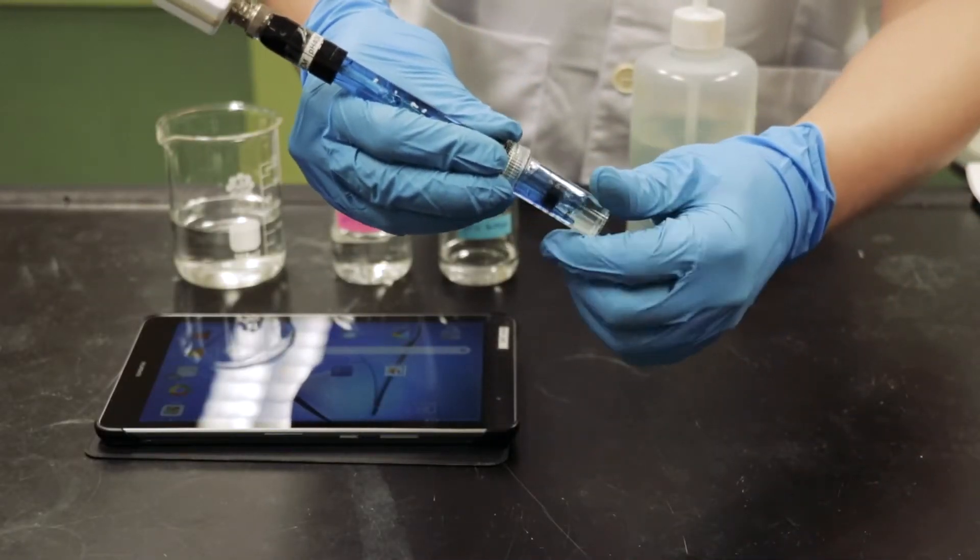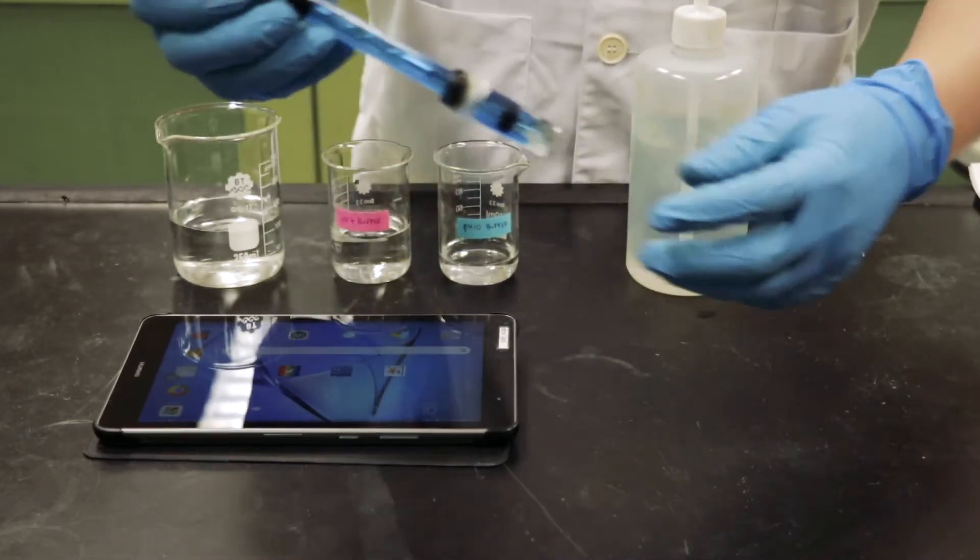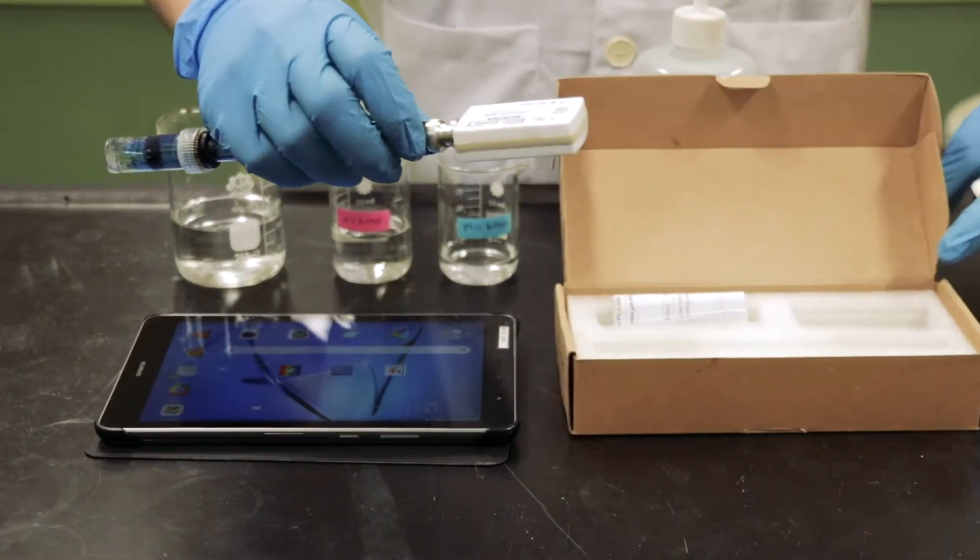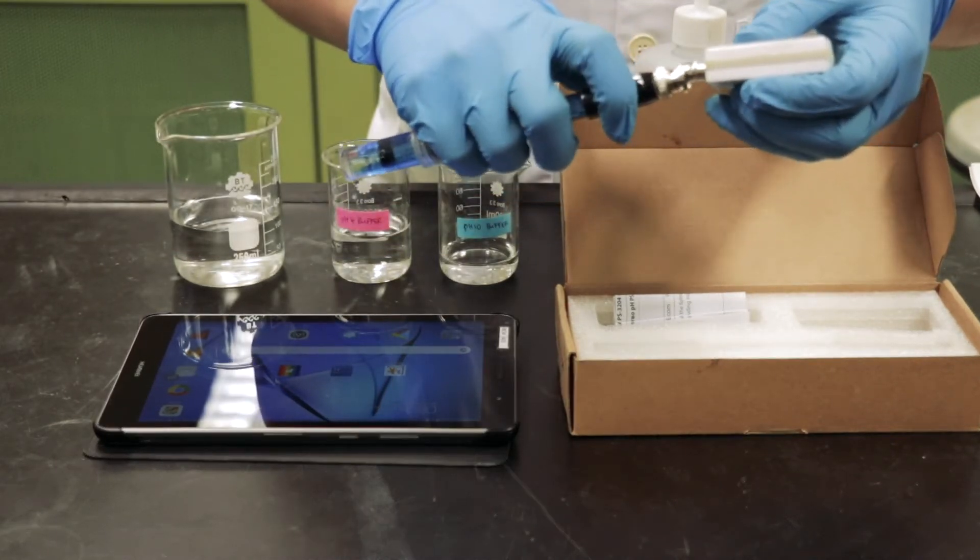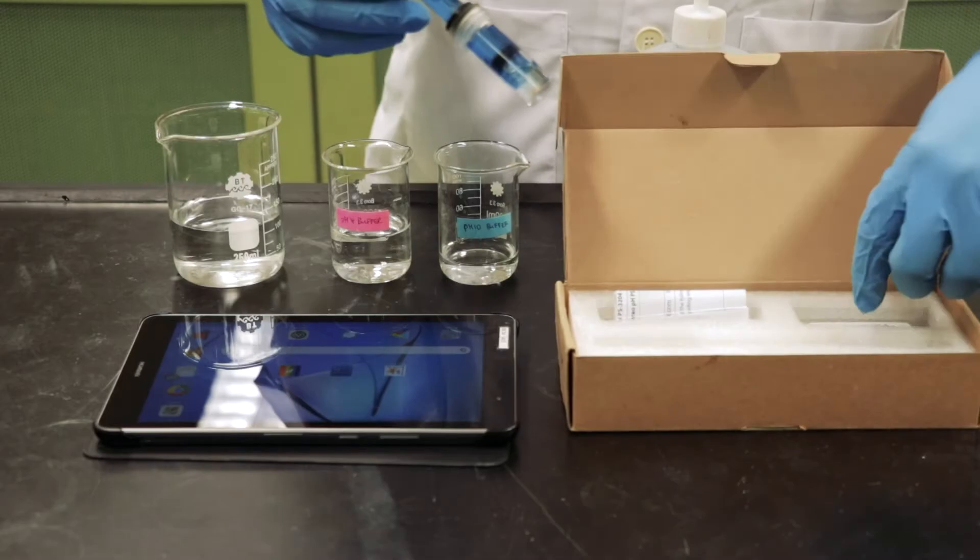repeat the aforementioned washing procedure and gently screw the storage valve back onto the PH Probe. Long press the power button to turn off the PH Probe and disconnect the wireless adapter, returning all components back to the box.